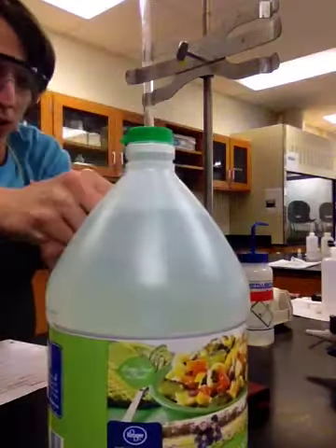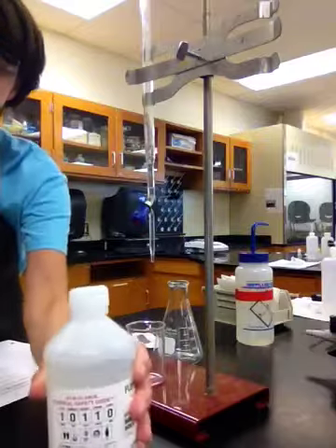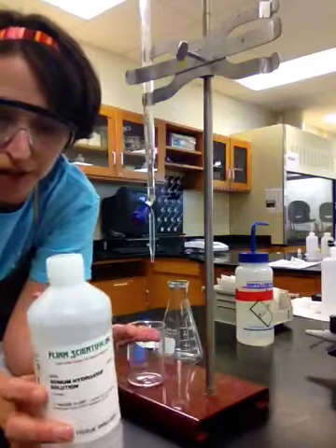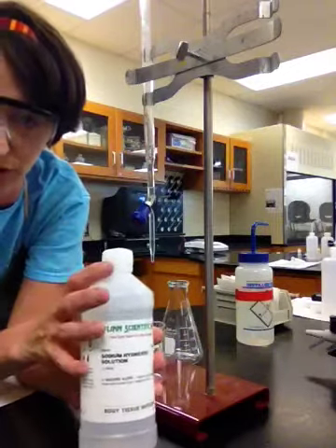And the idea is that we're going to take an acid and we're going to react it with a base. The acid in this case is our unknown. The base is going to be our known. Our base is sodium hydroxide, okay? So if it's our known, what do we know about it? Okay, well the base, it says here on the label, is 0.500 molar. So I know the concentration of the base.